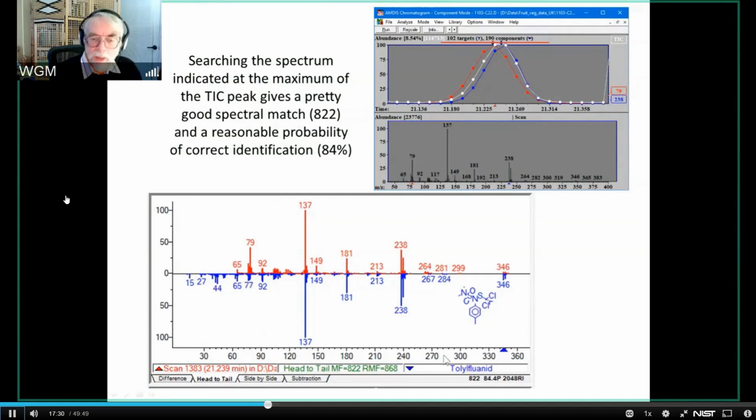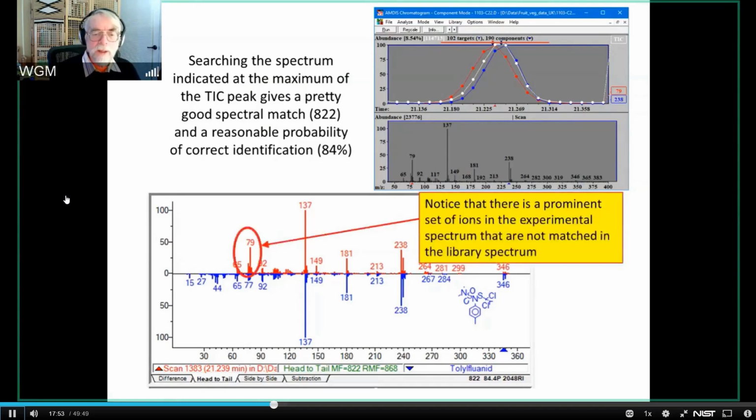I get a hit with a pretty good match factor, 822, and a pretty good probability of correct identification, which is 84%. And I look at this and I say, well, that spectrum doesn't look bad, until I look at it a little bit more closely. And what I discover are two things. One is that there's a cluster of ions, admittedly low-mass ions, and one is always more suspicious of low-mass ions, but there's a cluster here that aren't matched at all. And there's also a slightly higher mass, 149, that is very poorly matched.